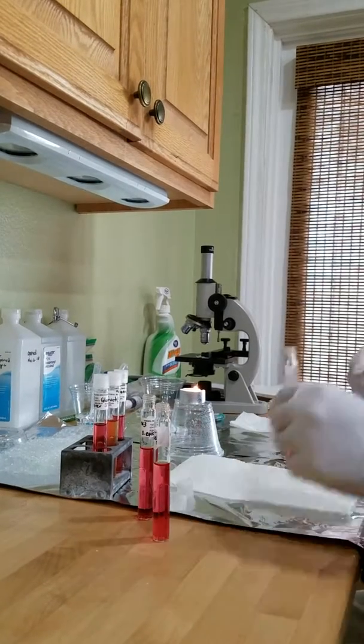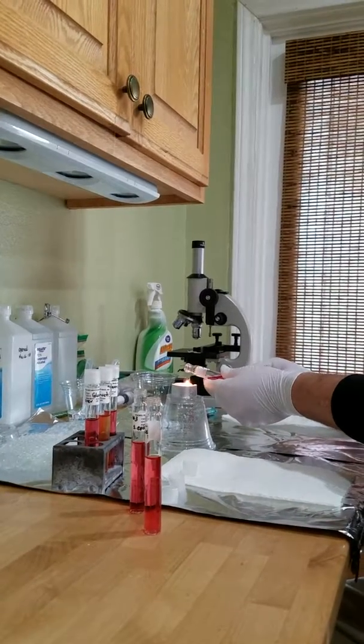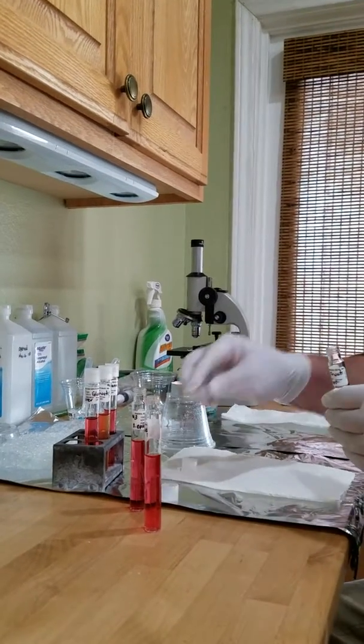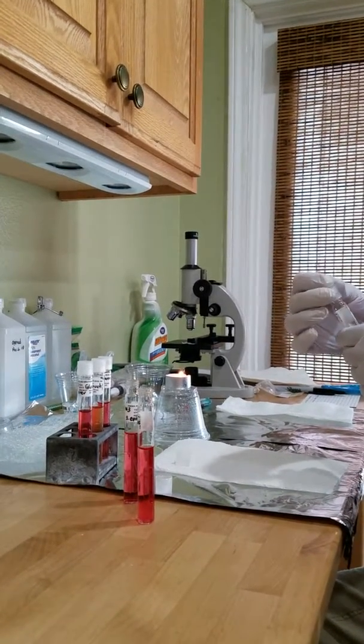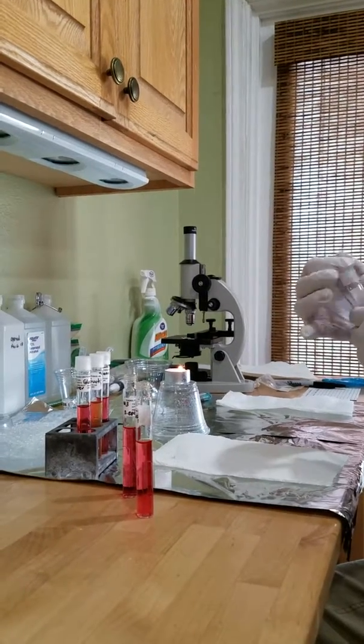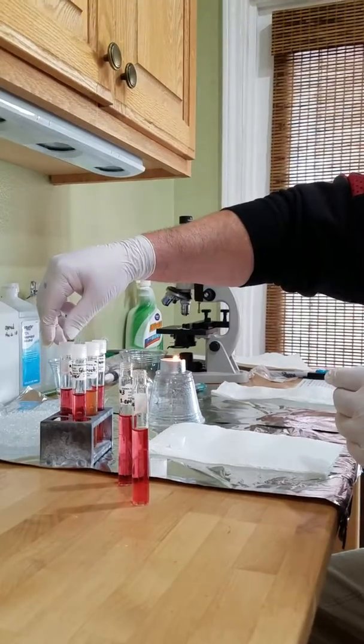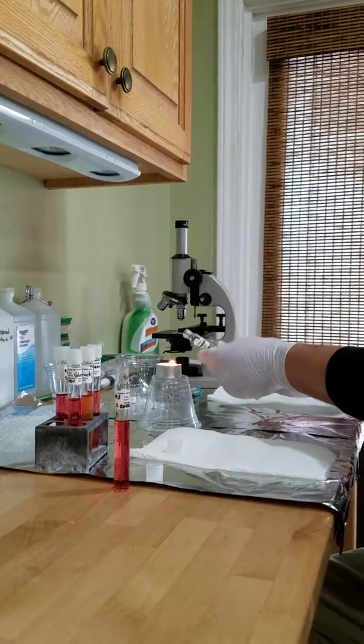We'll flame these one at a time here. This is two. Two's in the middle. This is one.